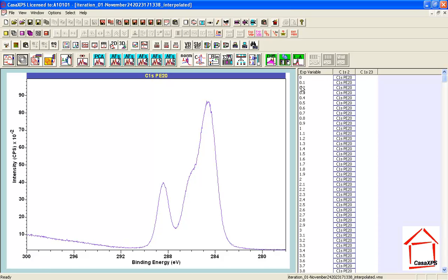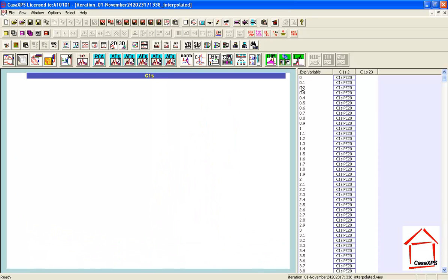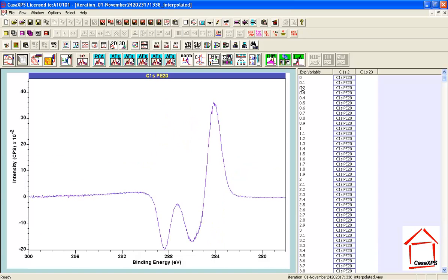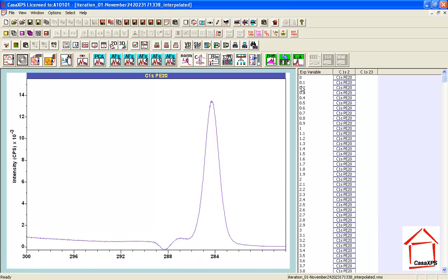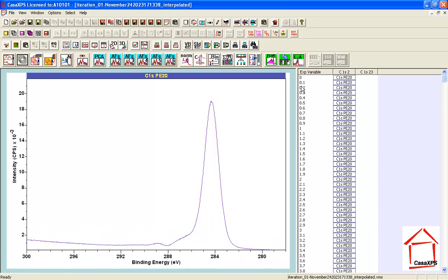Now, using the left arrow key, I move back to the column of difference spectra, and I'm looking for the complementary spectrum that should be there by virtue of the mathematics of calculating difference spectra, and I'm looking for something which is different from PMMA and looks very much like the type of data that is coming out of the measurement towards the end of the experiment. So this is not the beginning of the experiment, and this is not the end of the experiment. These are a set of measurements that were in the middle part of the experiment, and I've now found two shapes.